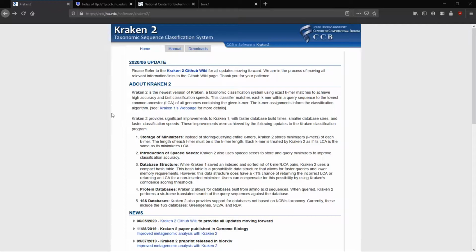And using BWA in this case to align our reads to rRNA, we can go through and use that SAMTools view and pull out those reads like I had talked about in the last video. So BWA is one that keeps the unaligned reads, whereas STAR, you have to tell it to keep those unaligned reads in the separate file, which we had mate1 and mate2.